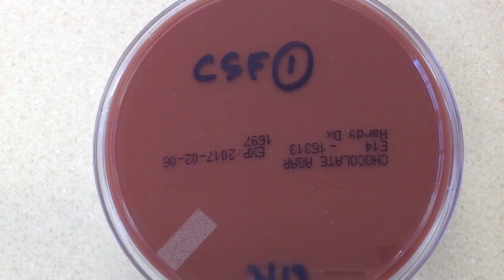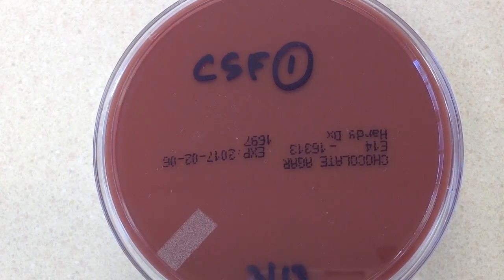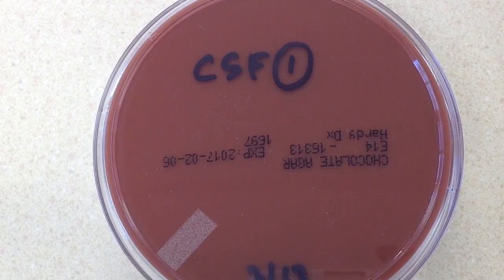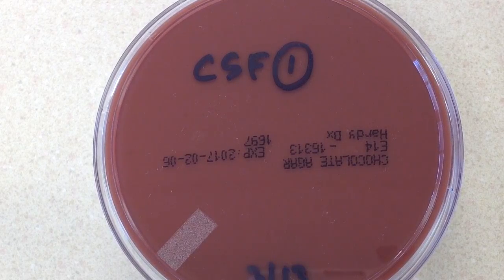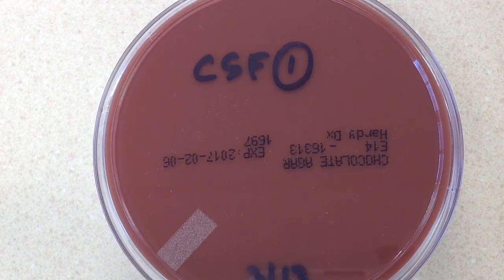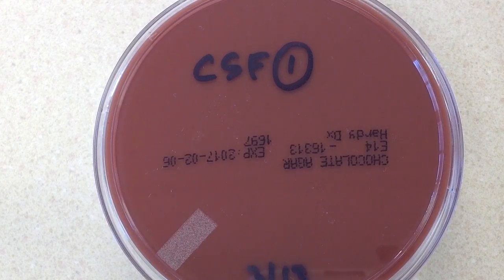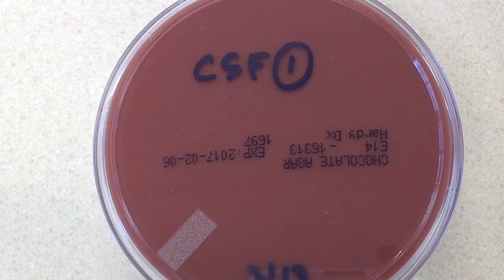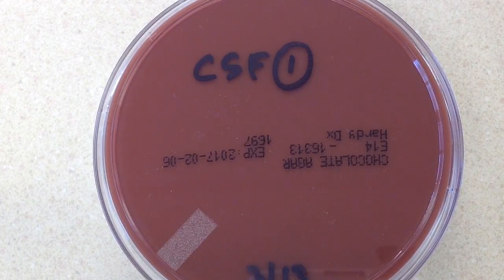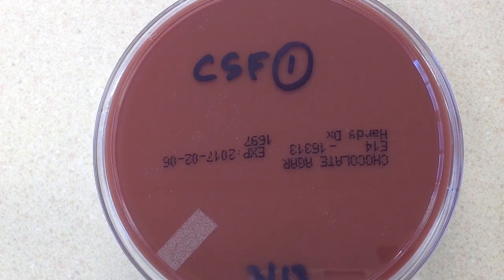This is a CSF culture on a 21-year-old male college student. When this particular type of specimen comes to the microbiology laboratory, the first thing that's going to be done is a cytospin gram stain will be made.